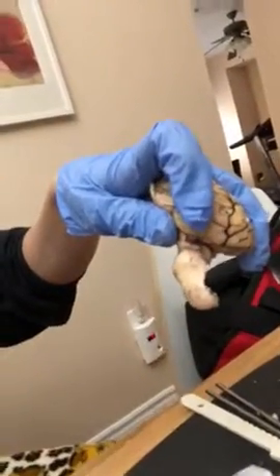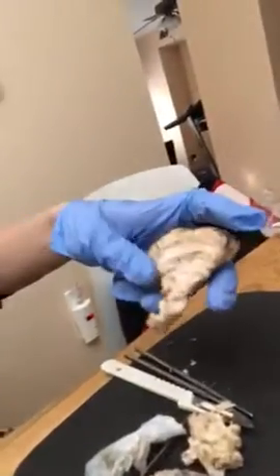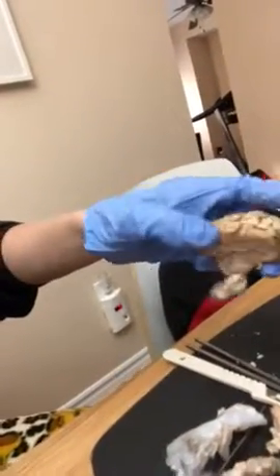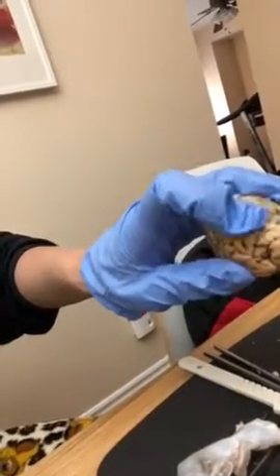The last three things we'll go over: I'll start with the corpora quadrigemina, located close to right here, under the pineal gland. Then we have the pineal body, right around here. And the cerebellum with arborvitae — arborvitae is pretty much the white matter found here.